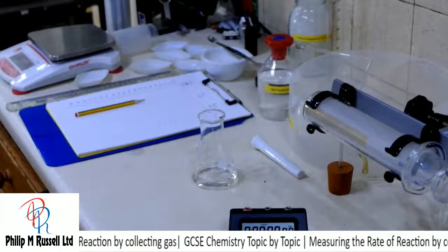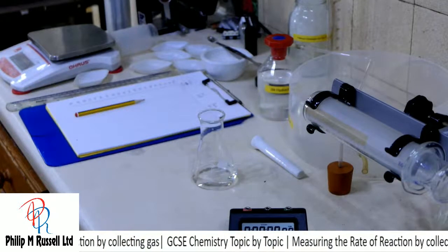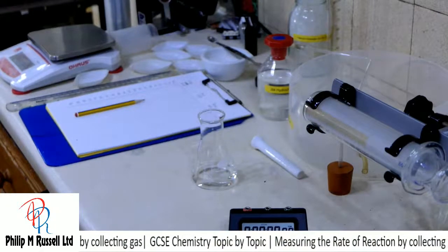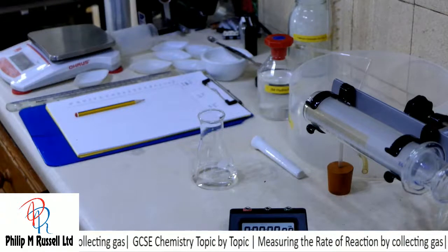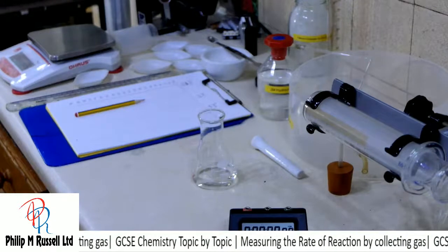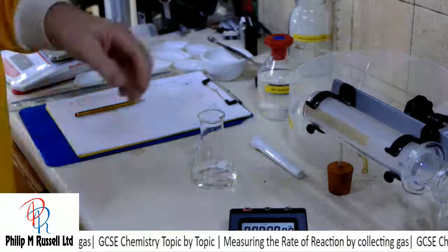Now, a slight change to the advertised procedure. I'm just going to wash my hands, because I've got a small amount of acid on my hands, and if you immediately wash it off, it doesn't matter. Right, we're ready to go.